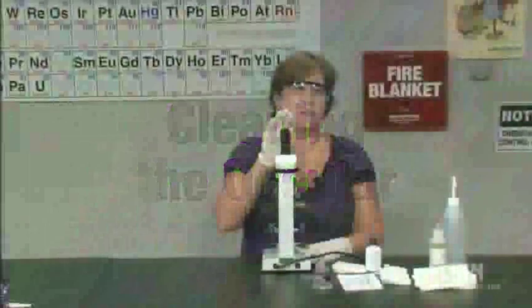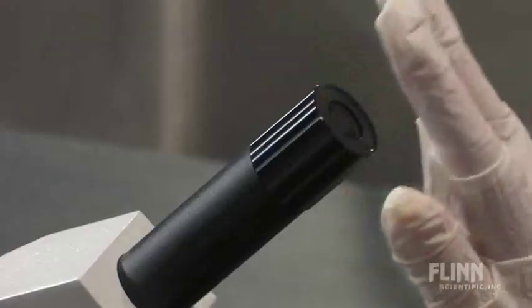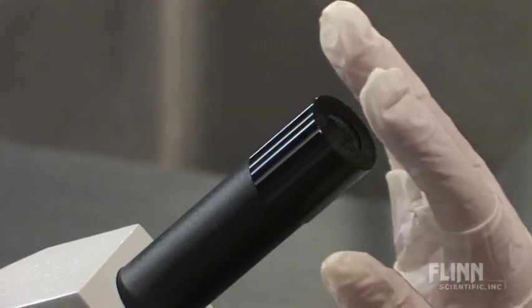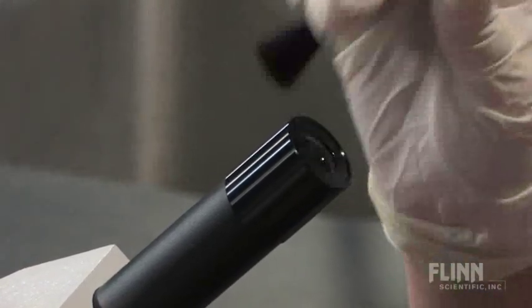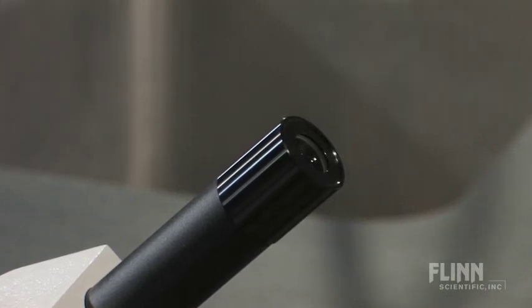Students often put their eyelids on the eyepiece or ocular, so skin oils and dirt are very common here. You're going to start by dusting off the ocular to get rid of any dust that might scratch when you use the lens paper.